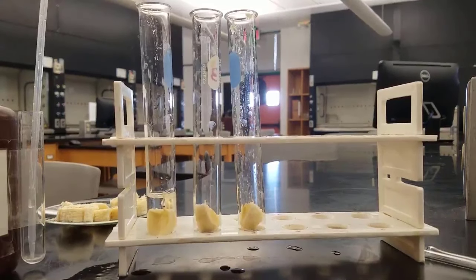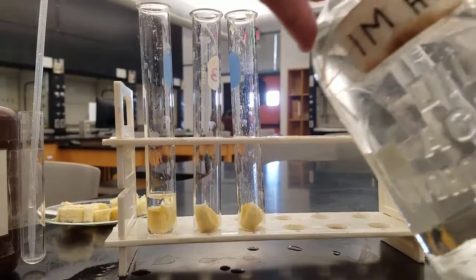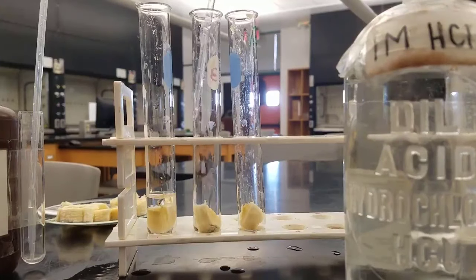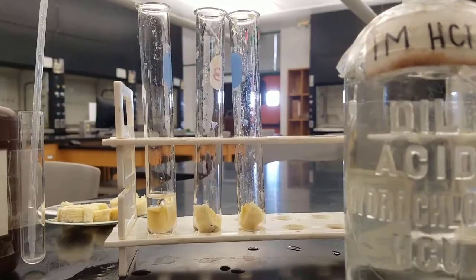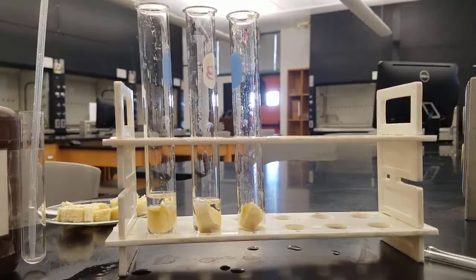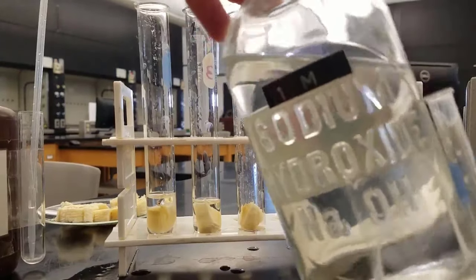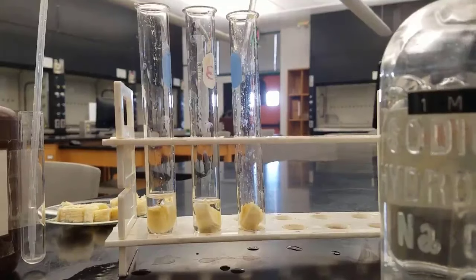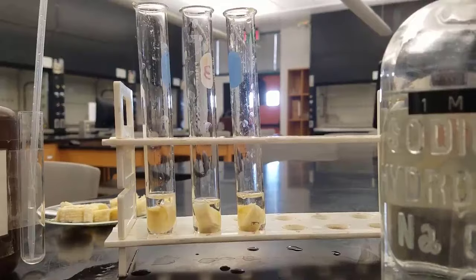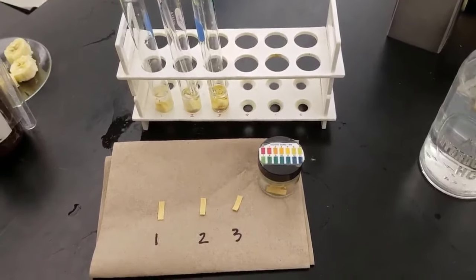First, we're going to put one milliliter of water into the first test tube, then take one milliliter of hydrochloric acid and put that into the second test tube. We want to control variables, so we're consistent and have about the same amount of liquid in both test tubes. In the third test tube we're going to add some sodium hydroxide — this is a base — so we have roughly the same amount of liquid in each test tube.